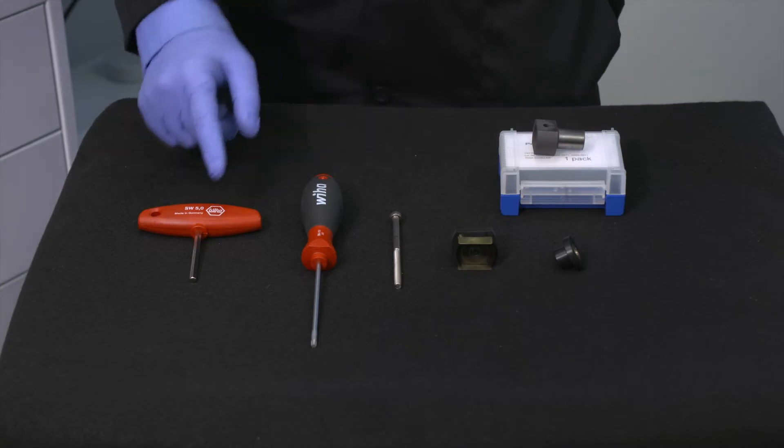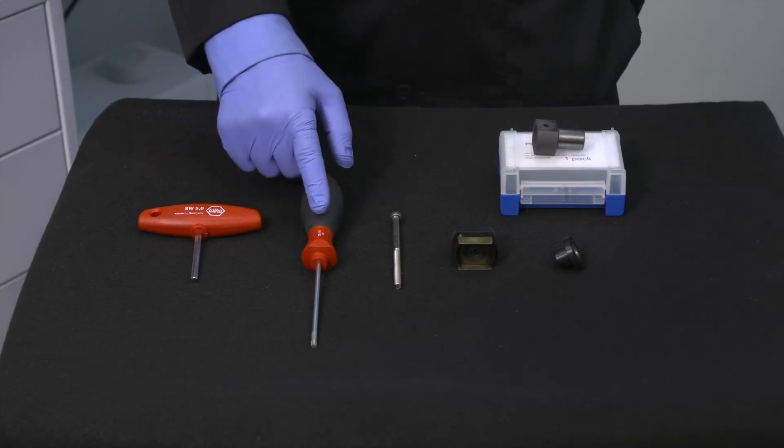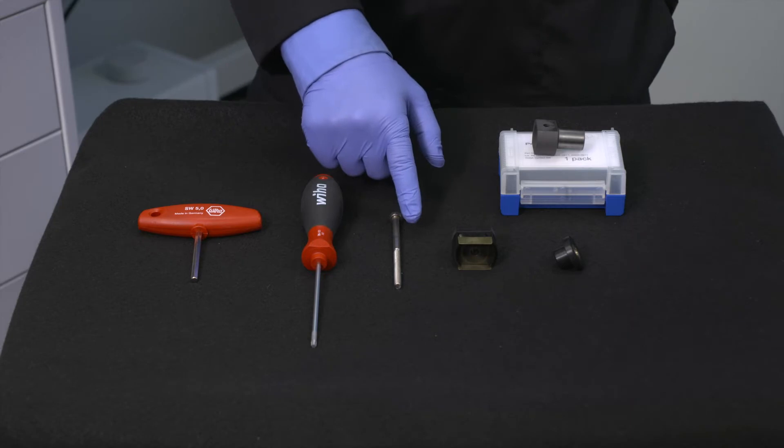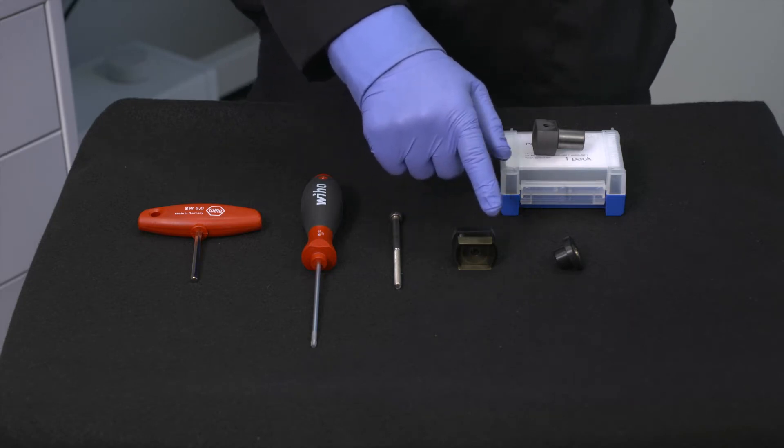To accomplish this task, you will need a hex driver, torx driver, as well as the long bolt, rear contact guide, and the threaded cylinder.